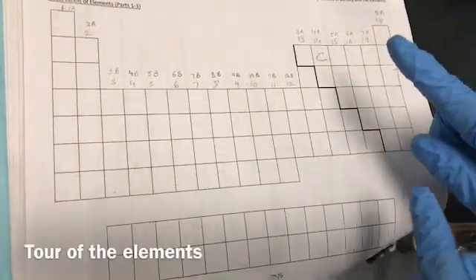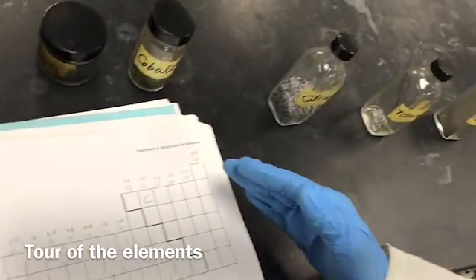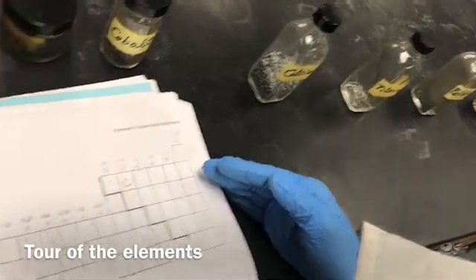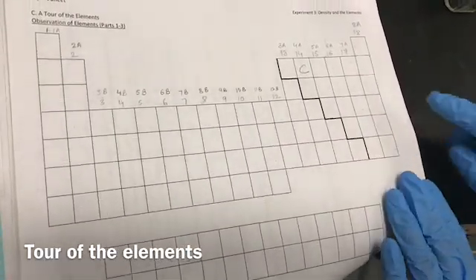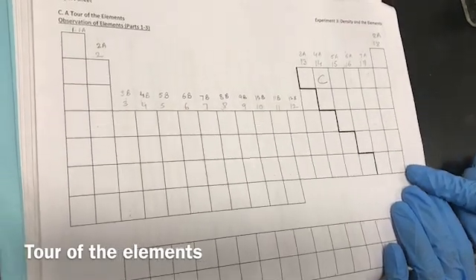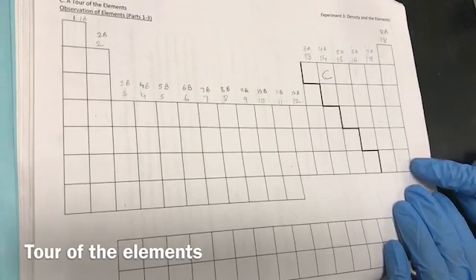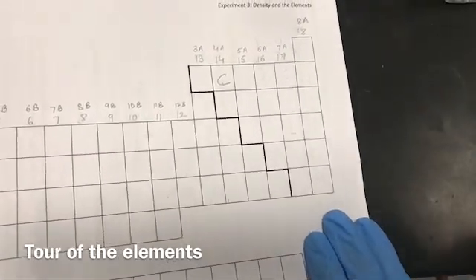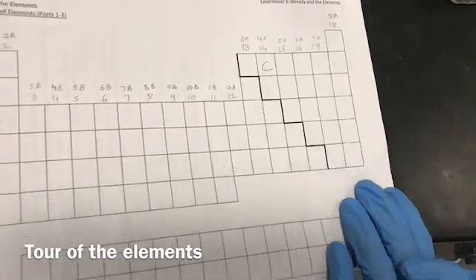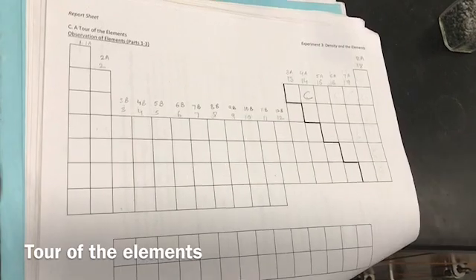So I'm going to show you different elements here. Not all of the elements present in the periodic table are displayed here. If they are gases which are not displayed here, you are going to write G. Mostly the noble gases you will find, which you write G, and L for liquids. And you can use different color pencils for that. If you do not find any solid displayed here, you are not going to write S for that. Just leave them blank.